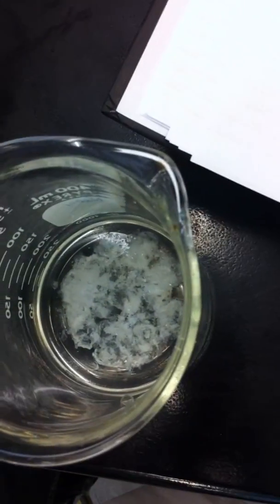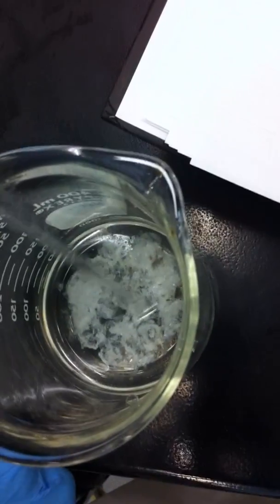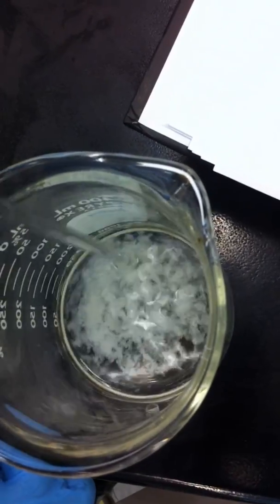Yeah, it says with continuous stirring and making observations. You have to stir continuous. Okay, did you do that? No. I didn't think so. No way. No observation.